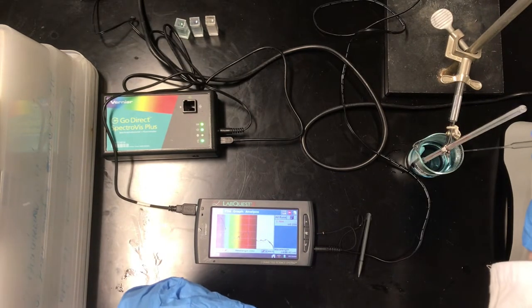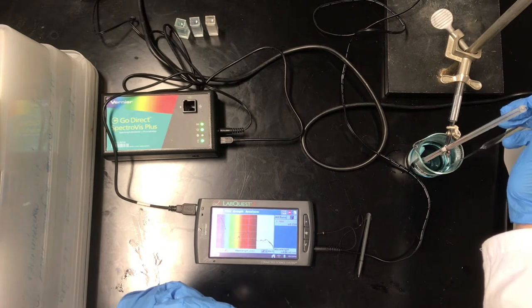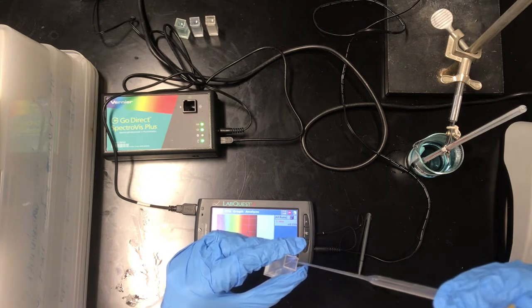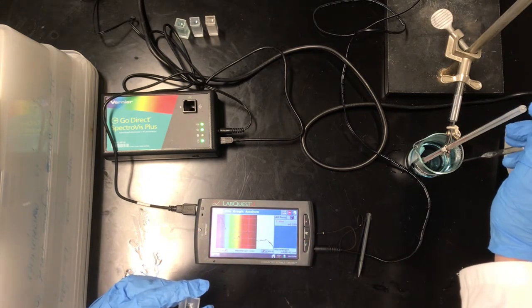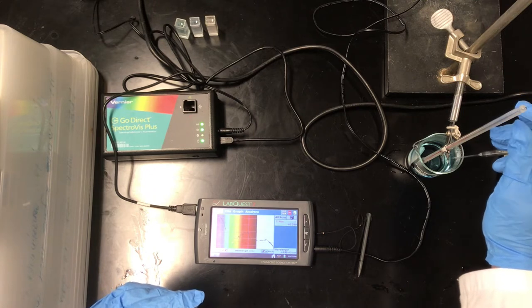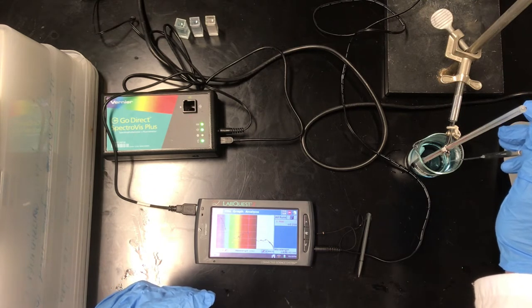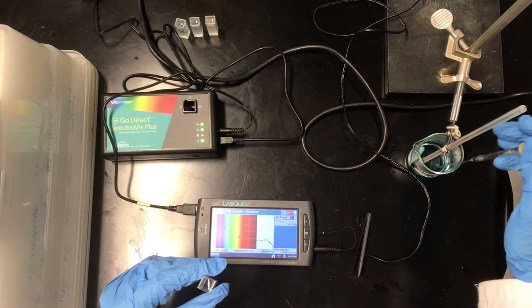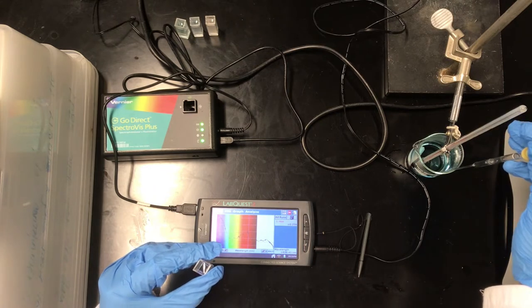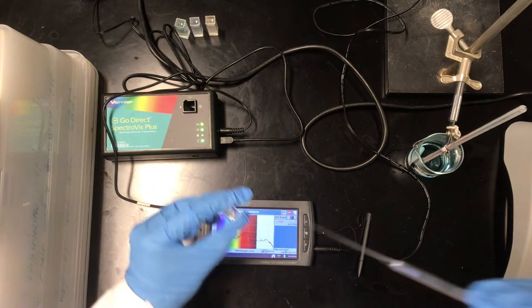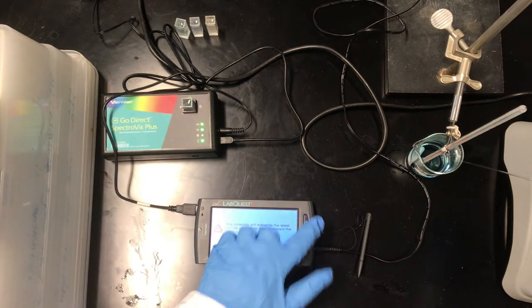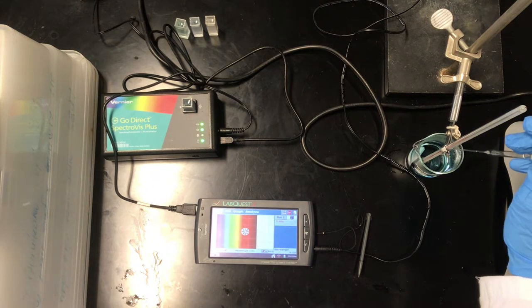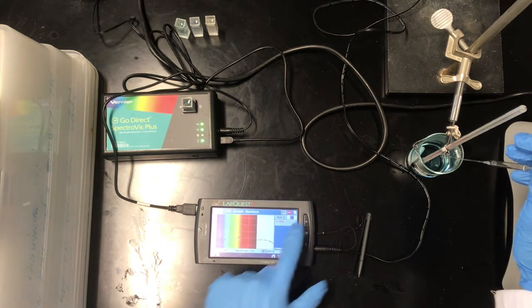All right, and now we're down to about 44 degrees Celsius, and I'm going to again measure the absorbance spectrum here of this reaction mixture. It still looks blue, it's not quite as vibrant blue as it was at the higher temperature, but we haven't really transitioned yet to a pink color at this point. And so again trying to do this as quickly as possible to maintain the temperature as best we can. We'll throw it in there, go ahead and hit play. We're going to store that first spectrum so that we can compare this one to the first one, and there it is.